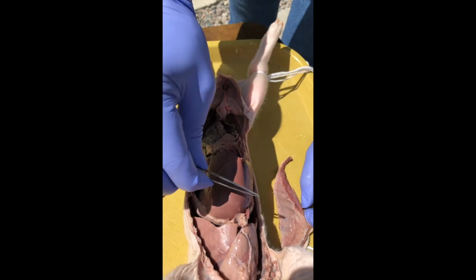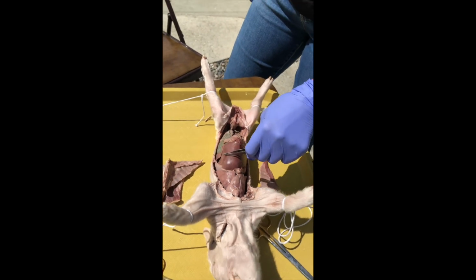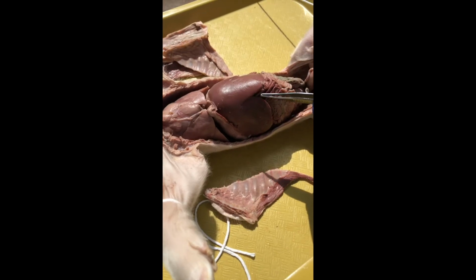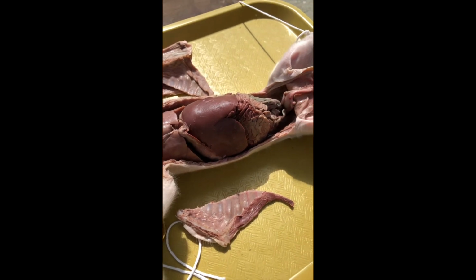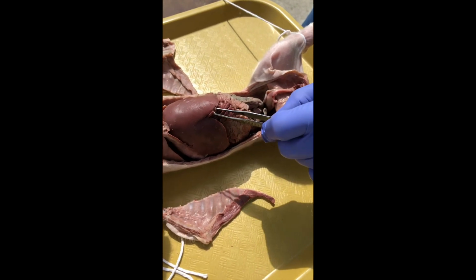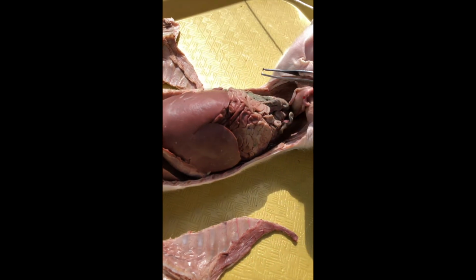So now we're in the abdominal cavity, and we can have a look at some of the superficial anatomy there. Big old liver. It's always really big. That's just how it is. And then a blood vessel that we can see sticking out of the liver. You remember that we bisected that to be able to fold back the posterior flap of the abdominal wall. That's the umbilical vein.